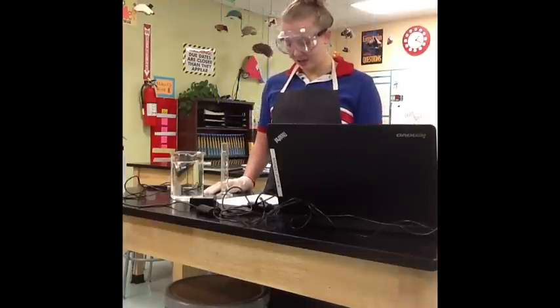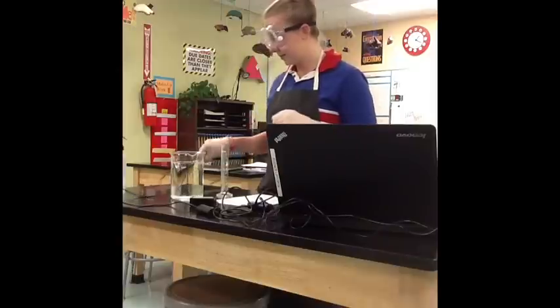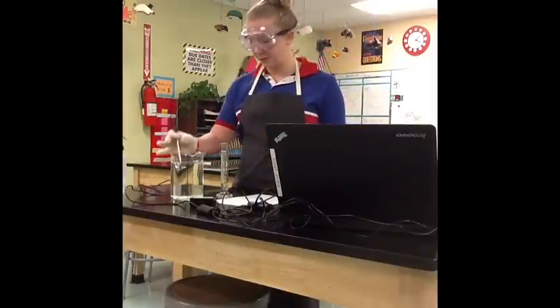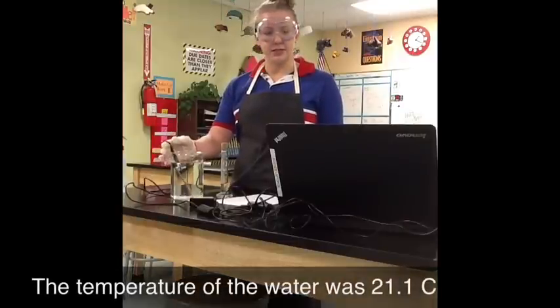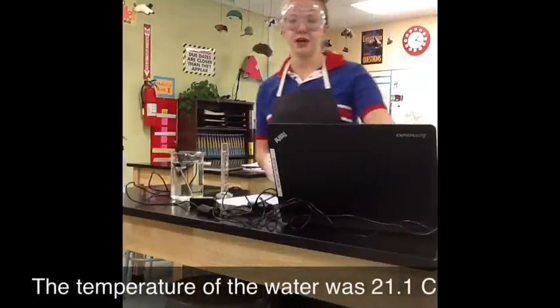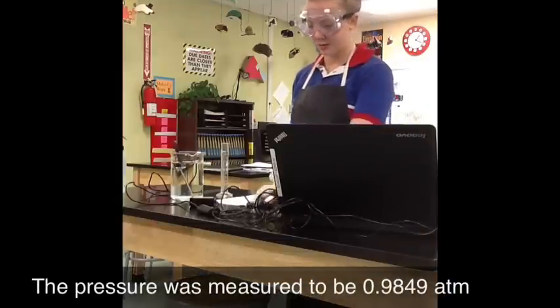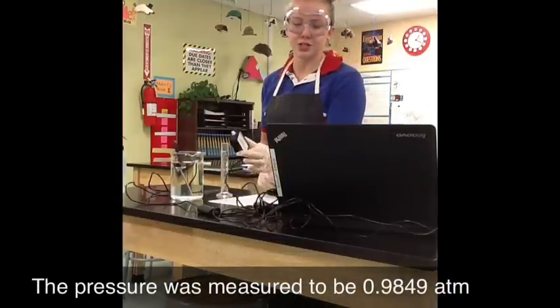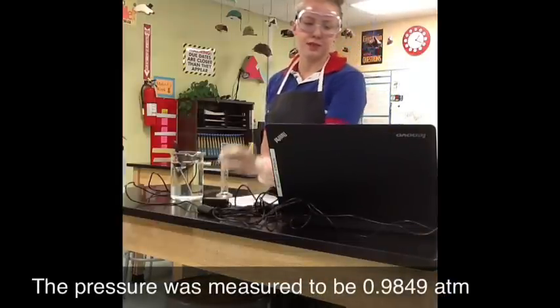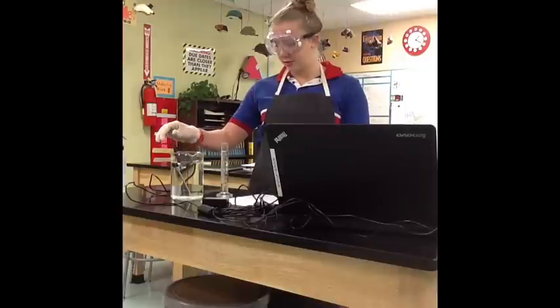And you're going to place your temperature probe in the water. So this is my temperature probe. You'll have it hooked up into the computer, and it will tell you both our pressure, because we have our pressure sensor. This is going to show the pressure of the room that you're going to need to record, and then the temperature of the water, which you'll also need to record.